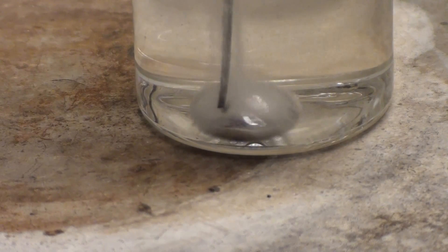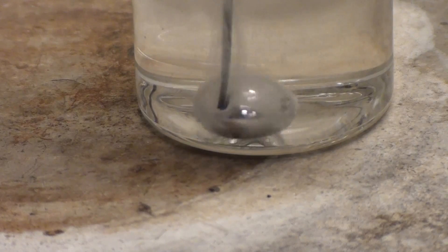Greetings fellow nerds. In this video we're going to perform the famous gallium beating heart experiment.